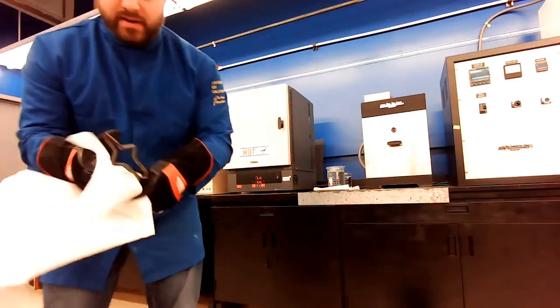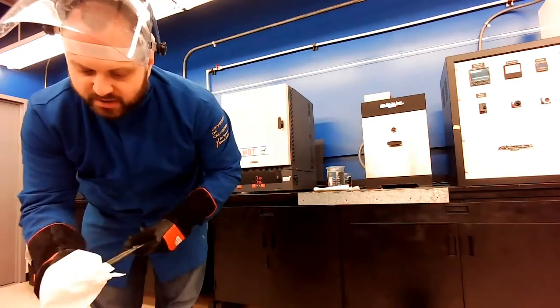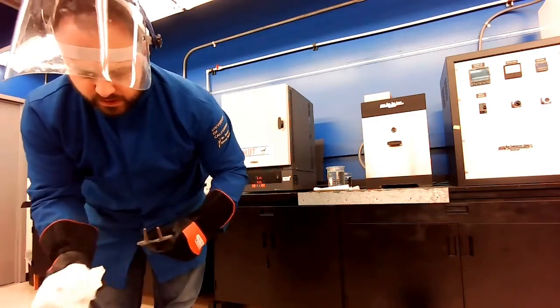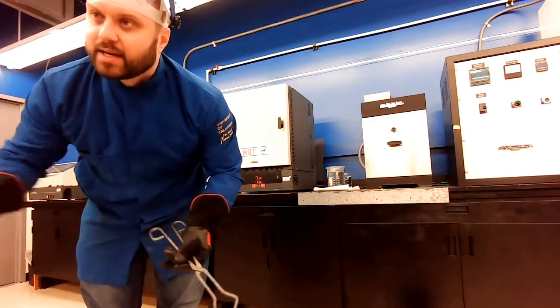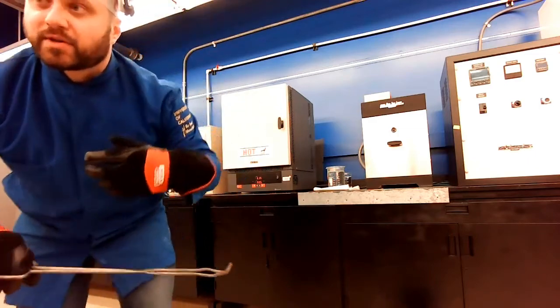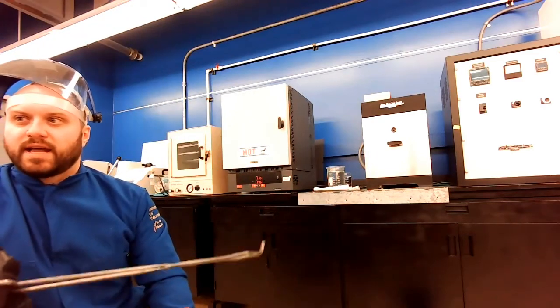Remember, I have 2 martensite samples. I want to quench down another one very rapidly, and then that's going to be the one that I'm going to take and make this tempered martensite. Okay, so I'm going to go through that procedure again. I'll put my mask down, go in and grab that other one, and get that quenched out.